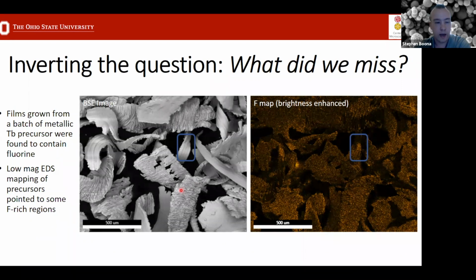So in this particular example, these are metallic terbium shavings that were used as part of a precursor to grow some films, and inside of those films, it was found that there was some fluorine contamination. So in an effort to track down where that was coming into the samples, SEM-EDS was selected as one of the techniques to try and search for the origin. So to do this, started with a fairly low magnification element map to look for hints of a fluorine concentration.